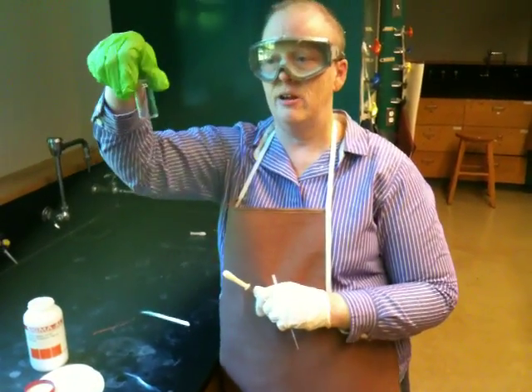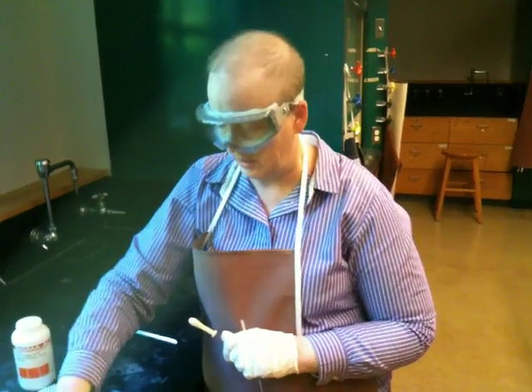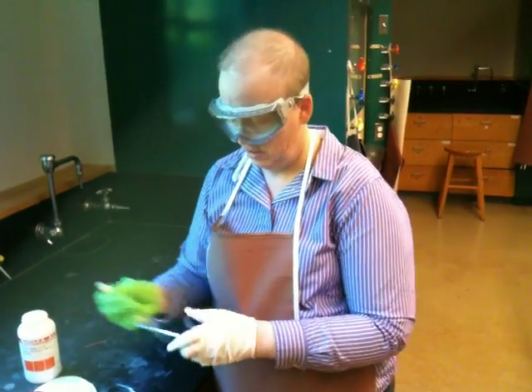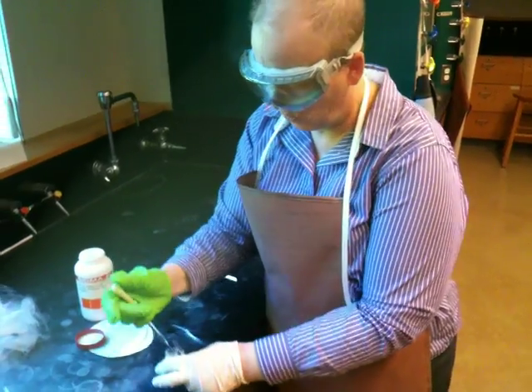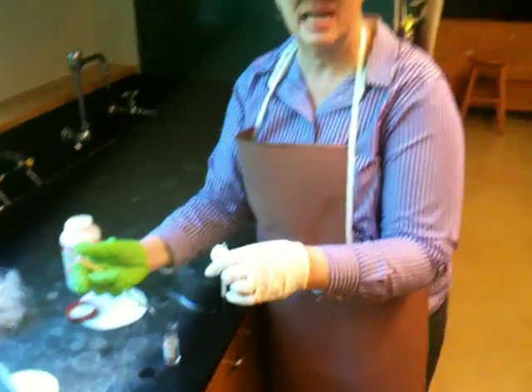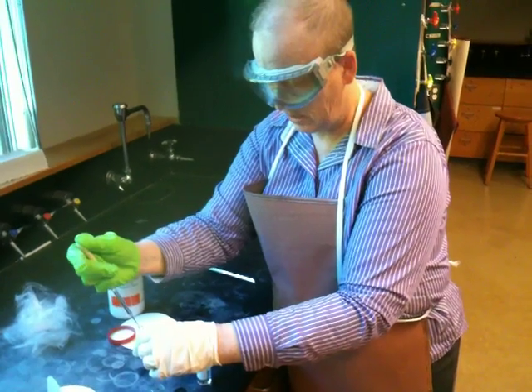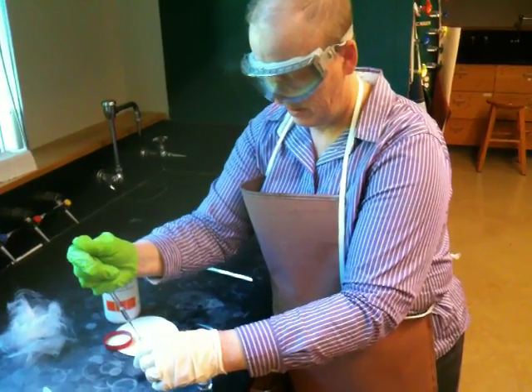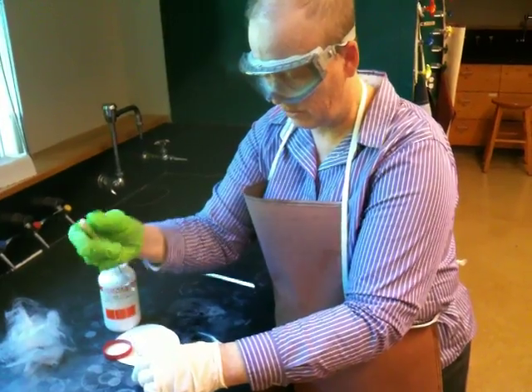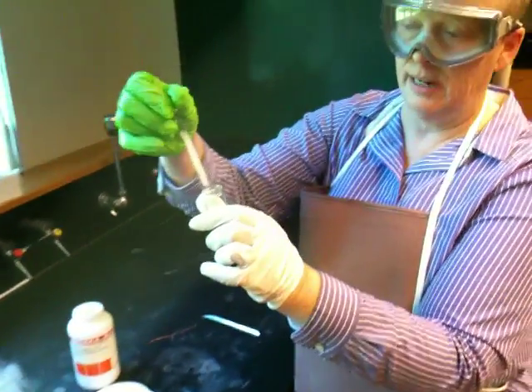Now this would be a tared vial or container for your final sample. So that means you've weighed it first. I'm going to take my liquid, which is wet. And what I mean by that, again, is it has some water in it. And what you want to do is drizzle this through this little column that you've made. And you want to get it to percolate through the drying agent into this new container.